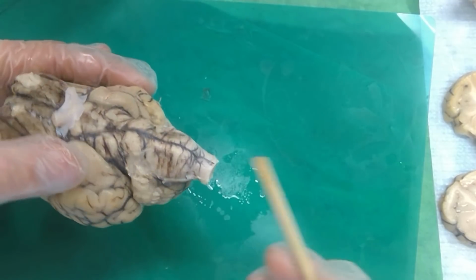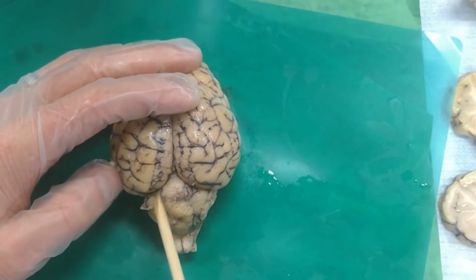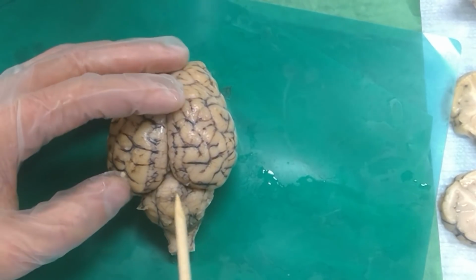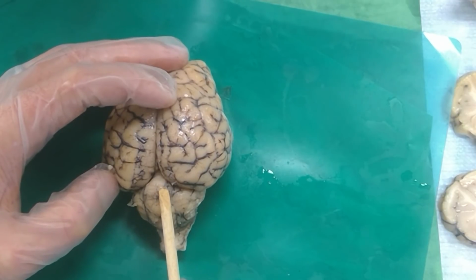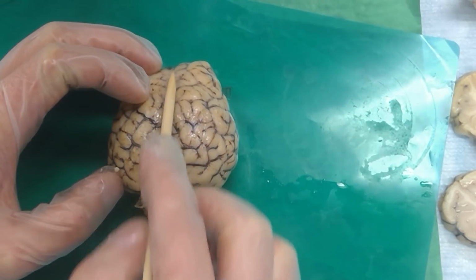And then what about the vermis? Oh yeah, and so then the central part of the cerebellum right here, vermis. What's the big sulcus up there, like the one that divides your brain? What's that called again? Oh, this is the longitudinal fissure. I don't think that's on your list, but it's fun to know.